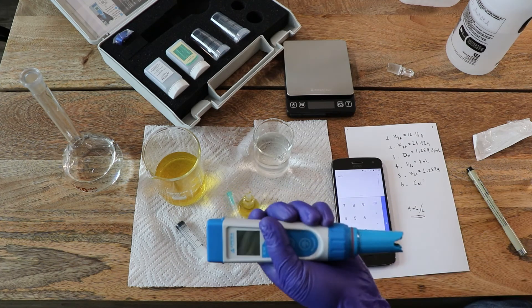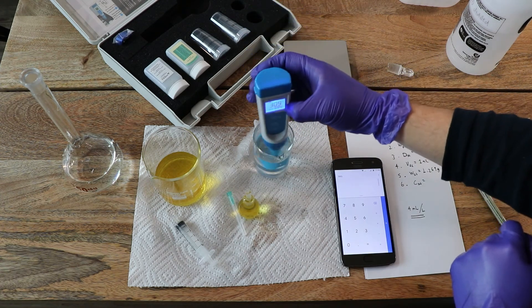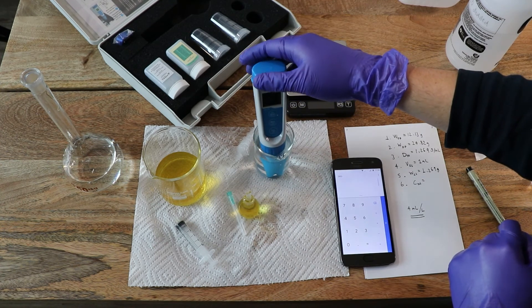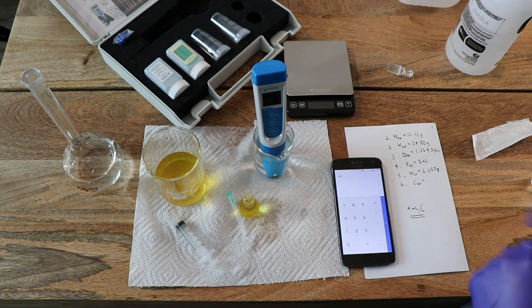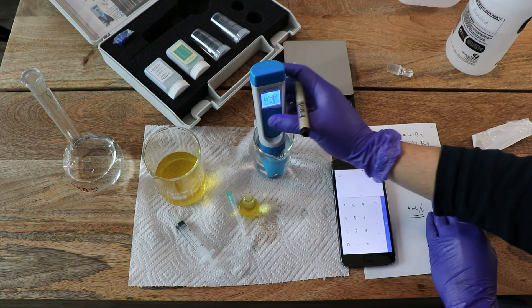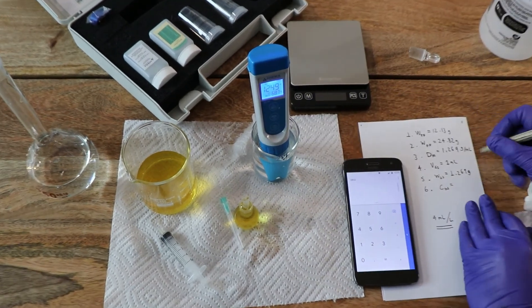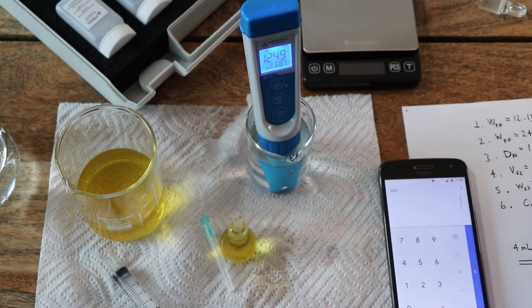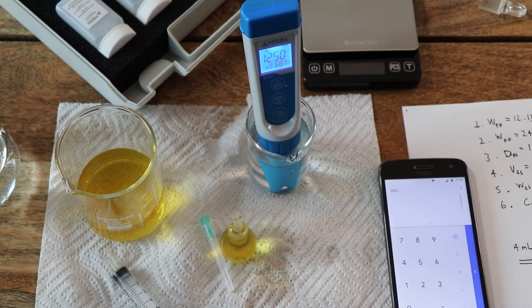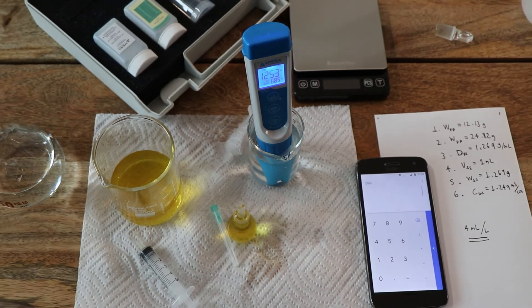I'm going to ensure the probe is dry. The final conductivity of this is — as you can see, we have the happy face there which means the measurement is stable — so the conductivity is 1.249 millisiemens per centimeter, or around this value.